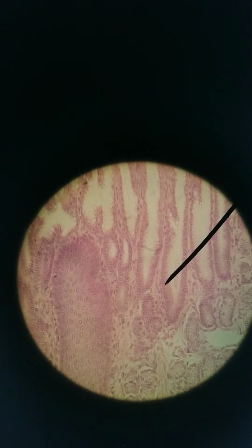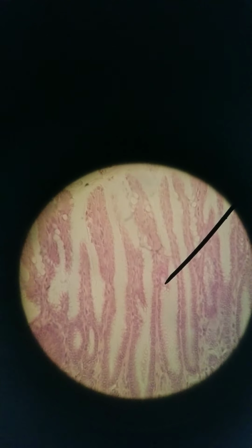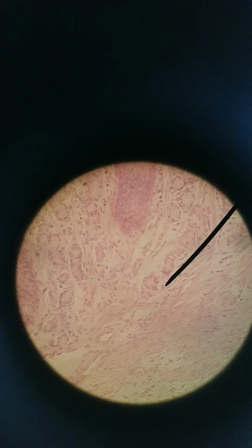So these are pits. We've transitioned from the esophagus to the stomach. What the arrow is pointing at are gastric pits, and the pits can go pretty deep. If you cut a pit at a perfect angle, then it looks like it goes longer, but it's always hard to cut these tubes. They're never perfectly straight. So these ones that we see down here, these are still part of the gastric pits, like these circles over here. And gastric pits are secreting acid, secreting enzymes, and there's even mucus cells.